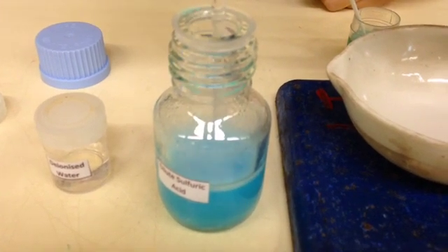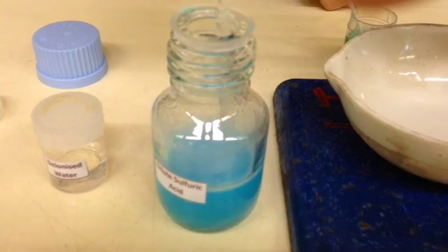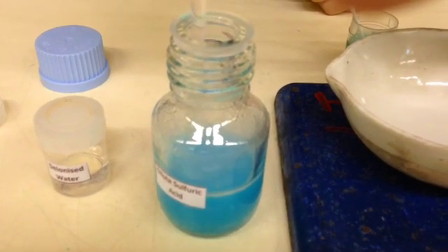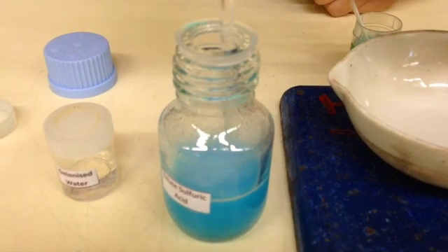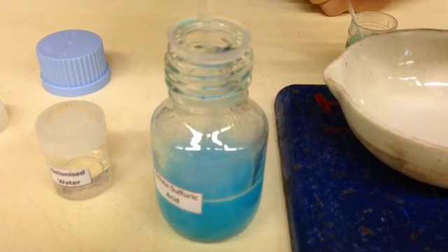Those of you who looked at the sulfuric acid just now, you have noticed that the sulfuric acid is colorless. But now you see that the solution has changed color to a blue color. And this solution is actually copper 2 sulfate solution.